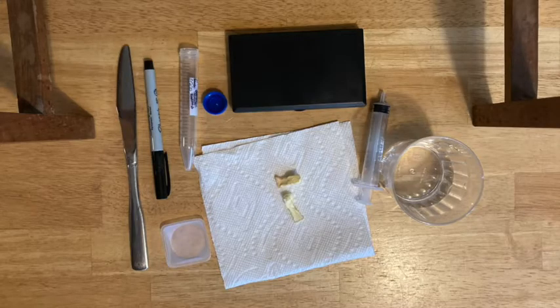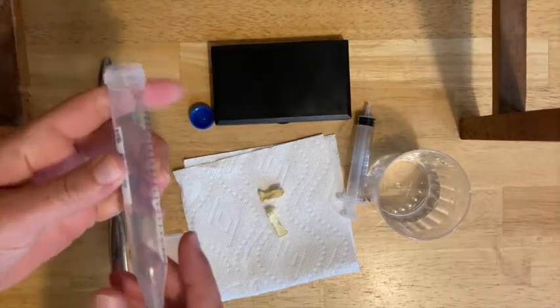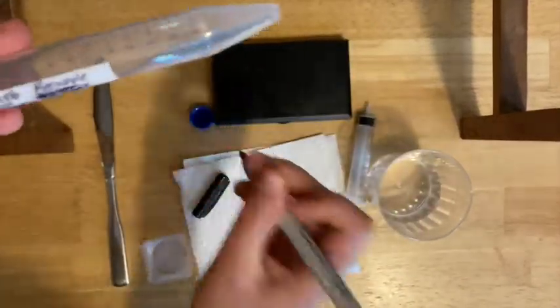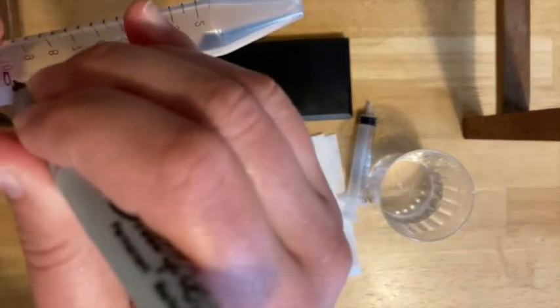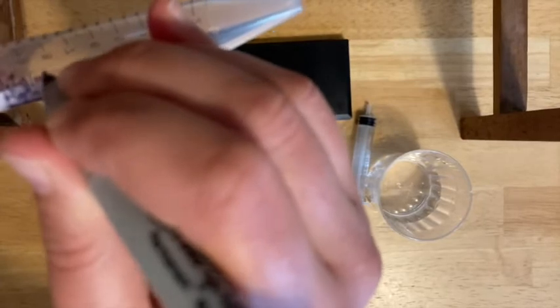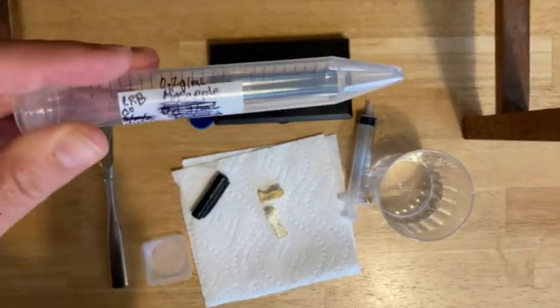As usual the first step is to gather your supplies. You are then going to rehydrate your freeze-dried pineapple. Make sure that you label your tube clearly — initial, state, period, and then the concentration, which in this case will be around 0.2 grams per milliliter, and then the compound, so pineapple in this case.